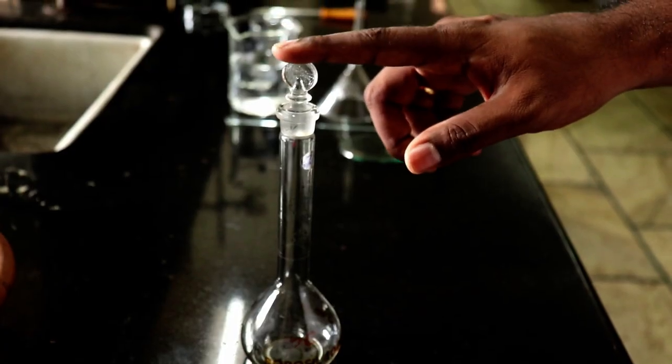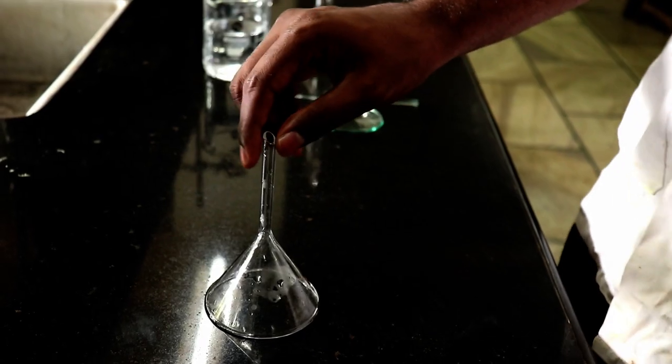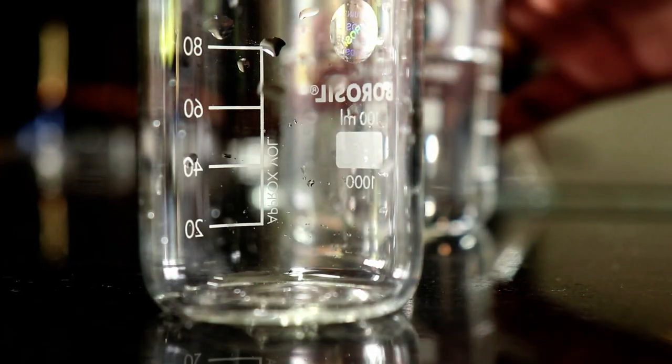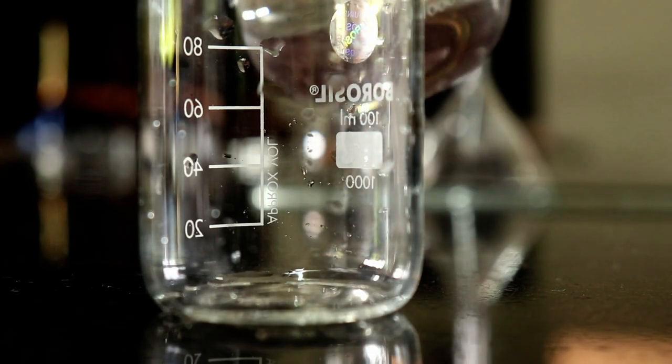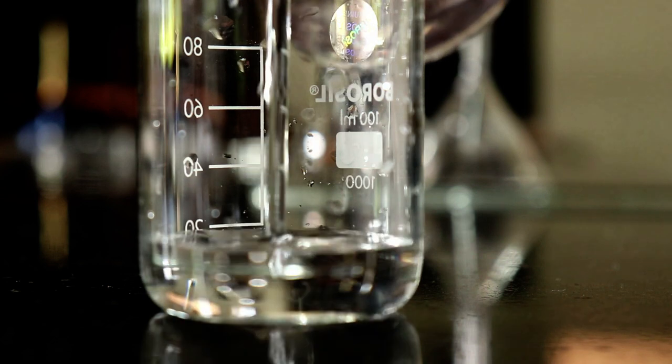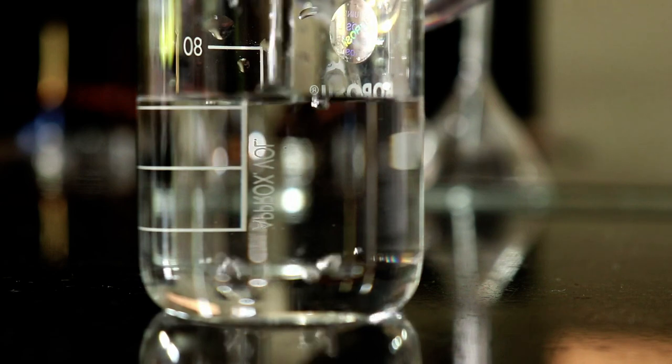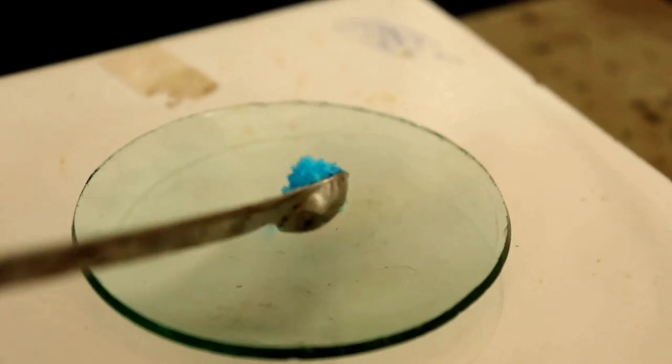This is a standard measuring flask, funnel, glass rod, watch glass. Take distilled water in a beaker. Weigh appropriately the required amount of the substance.